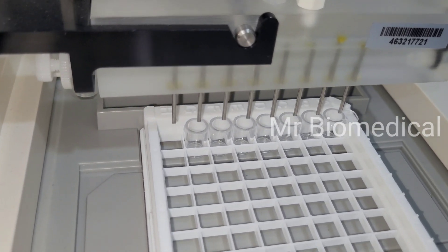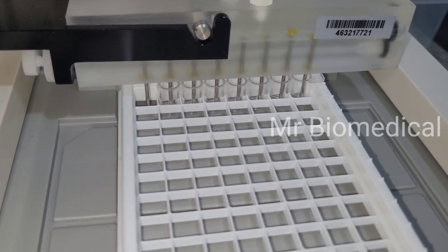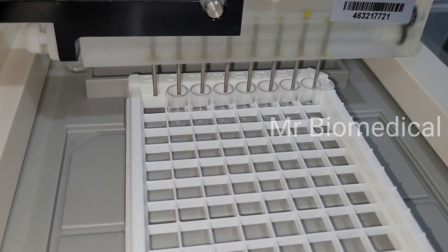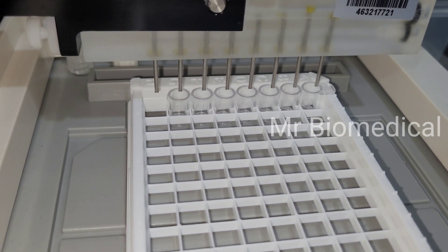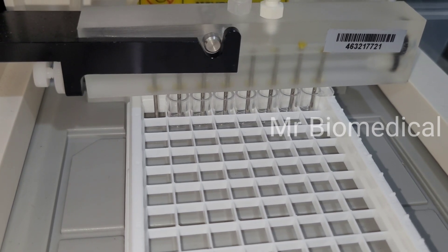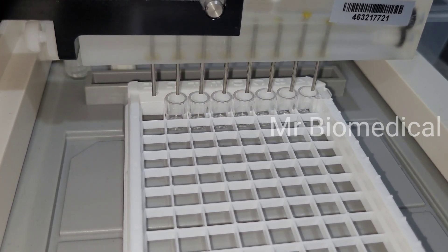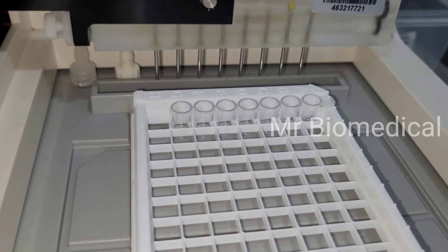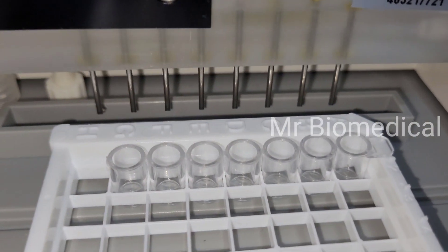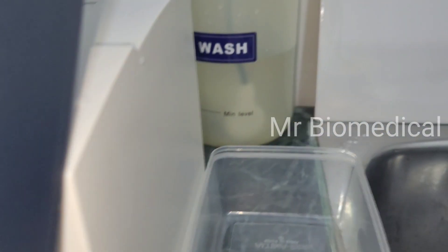As you can see there's no water but machine is working good but water is not coming. So what will happen is sometimes the tube is twisted or pinched, so at that time it won't work, the water will not come out.